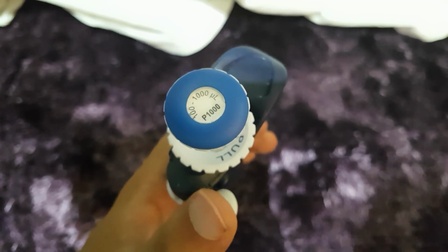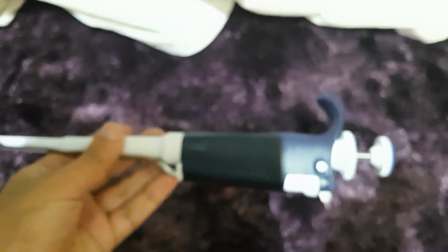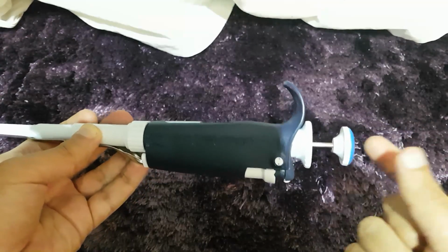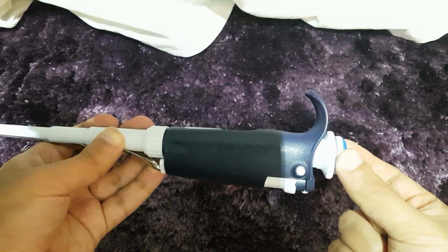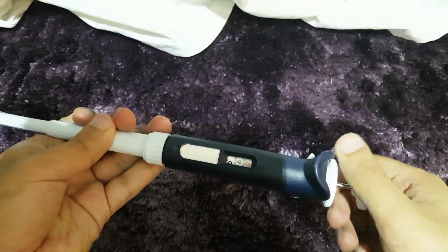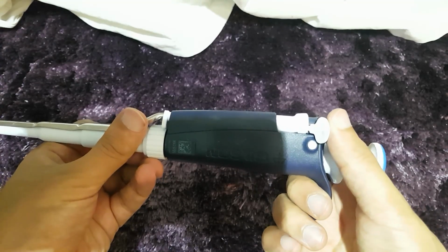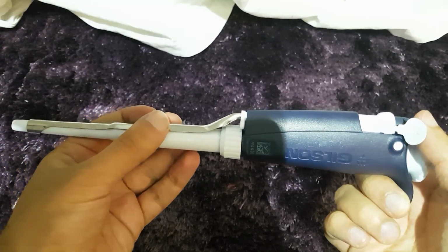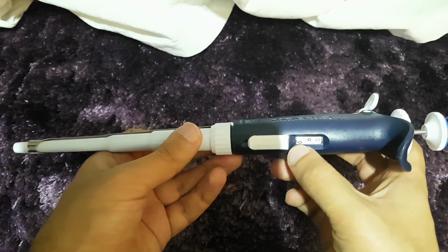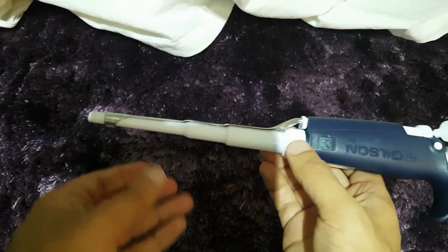So now that we know how pipettes work, let's have a look at this pipette. Let's just get into focus. Starting at the end here, we have the plunger button, and the plunger pushes up and down to blow air through the pipette. Next, we have the volume adjustment knob, and you can see it changes the volume dial. Next, this is the tip ejector button. You push it down, it pushes the tip ejector arm down, and this gets rid of the pipette tip. What we can see here now is the volume indicator, and this is the main shaft of the pipette.